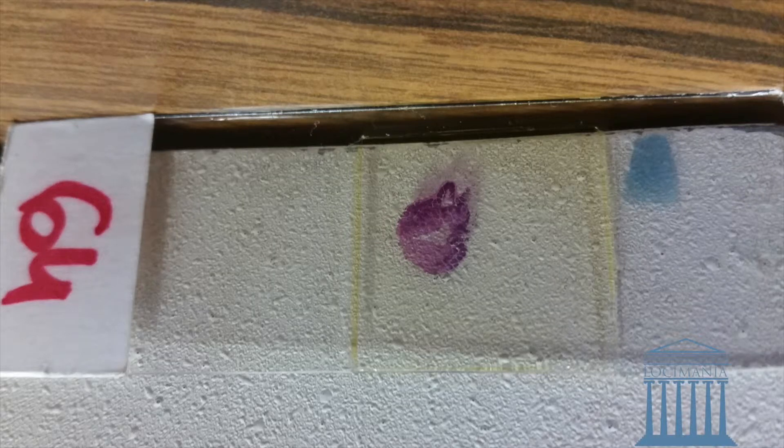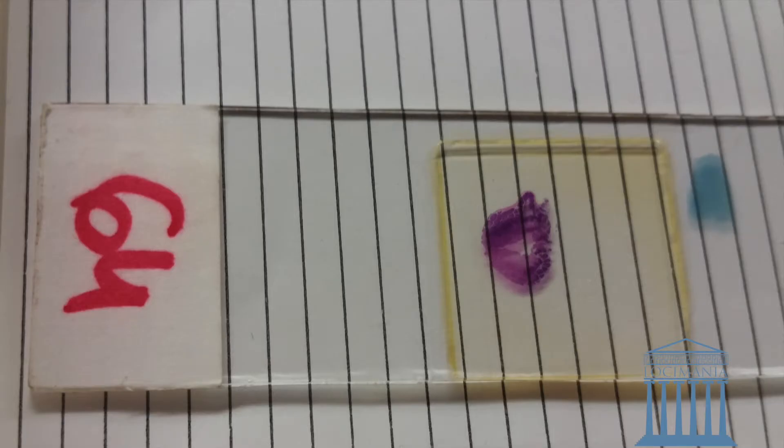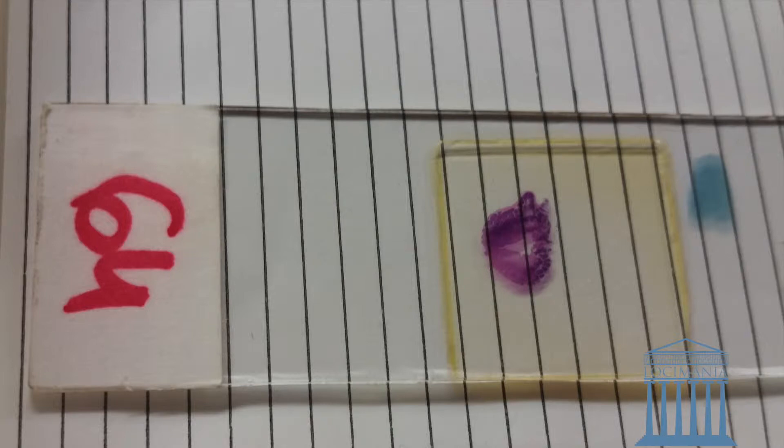Welcome. We have slide 64, the vermiform appendix. That was two pictures of the vermiform appendix. Let's go to the microscope.